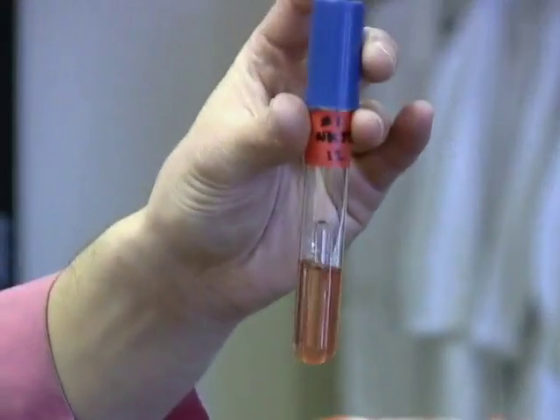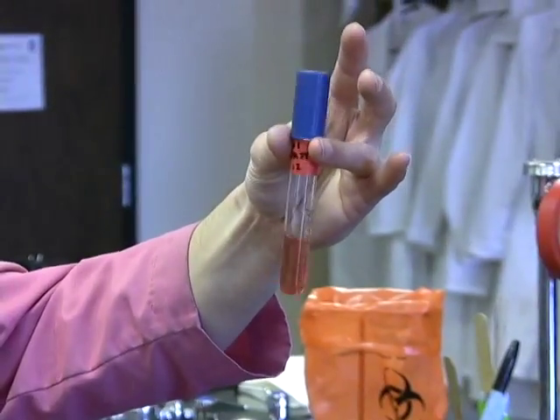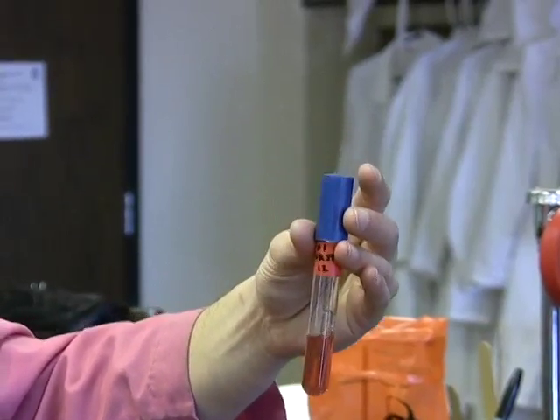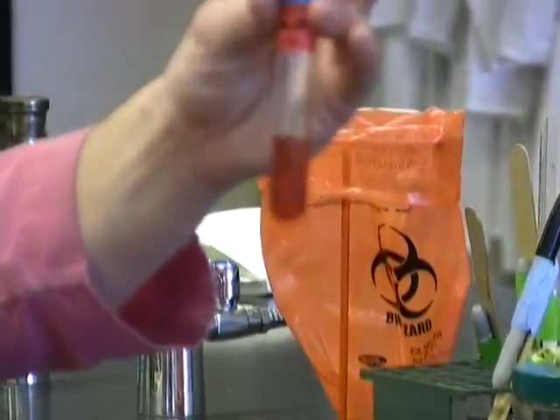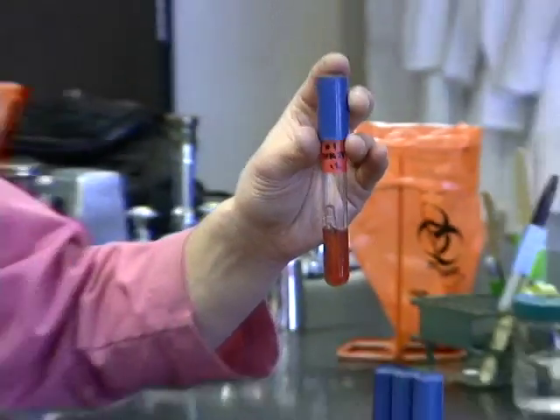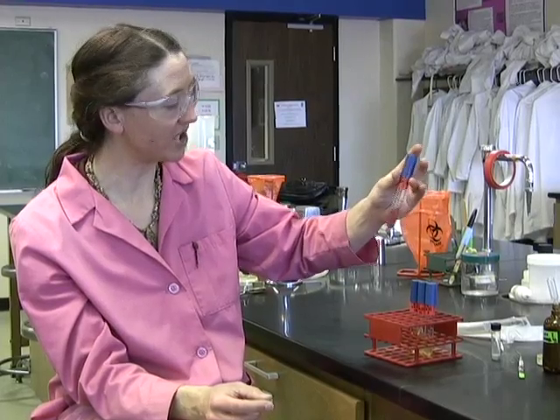Aha, voila. You can start to see the red color change. It's getting pink, it's going to get pinker, and eventually it will turn red. So this organism is positive for reducing nitrate to nitrite. So it's positive for the nitrate test, or we could say it's positive for nitrate reductase, or positive for nitratase. Those terms are used interchangeably for the enzymes: nitrate reductase or nitratase. So we get to see that dark red color change. This is one way to be positive: converting the nitrate to nitrite, and it stops there and reacts with your nitrate 1 and 2 reagents.